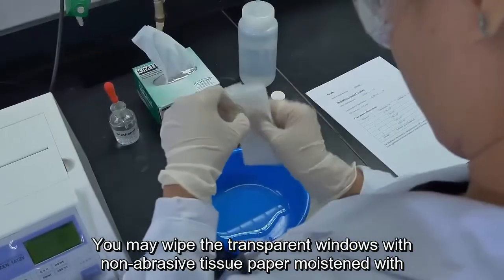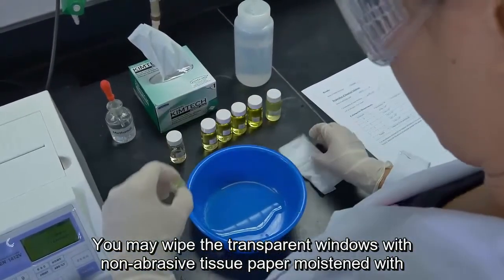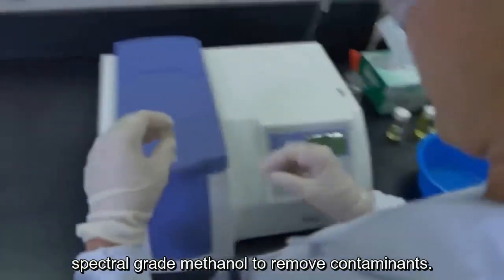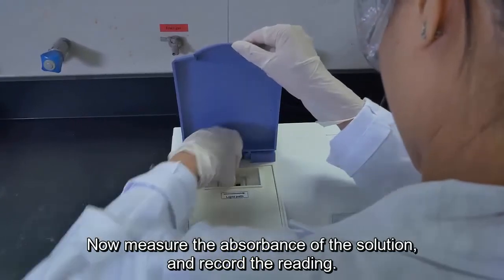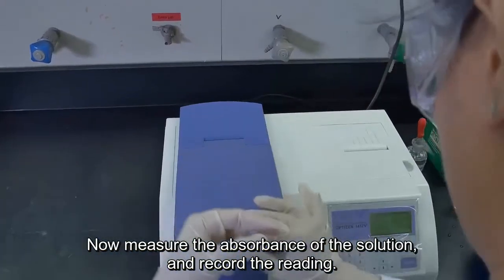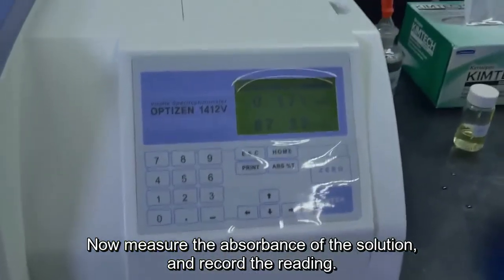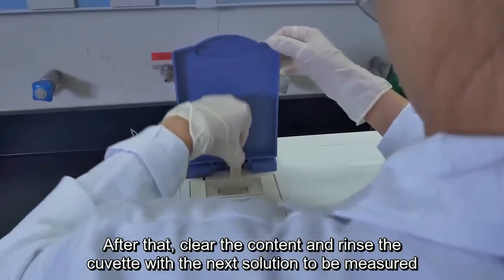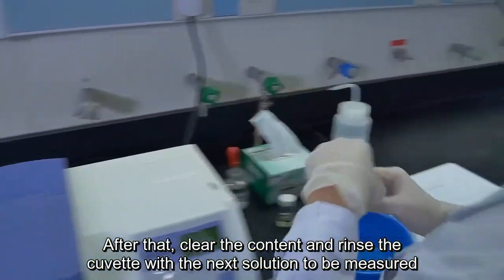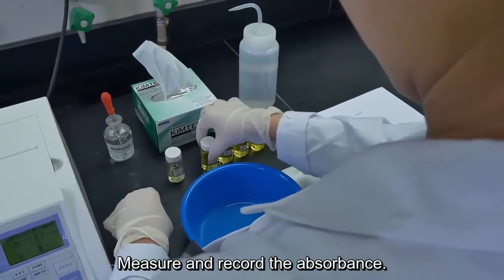You may wipe the transparent windows with non-abrasive tissue paper moistened with spectral-grade methanol to remove contaminants. Now measure the absorbance of the solution and record the reading. After that, clear the content and rinse the cuvette with the next solution to be measured 3 times. Measure and record the absorbance.